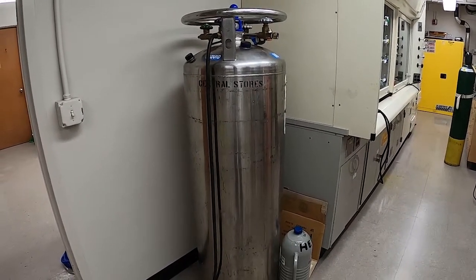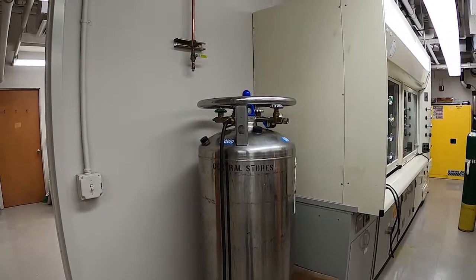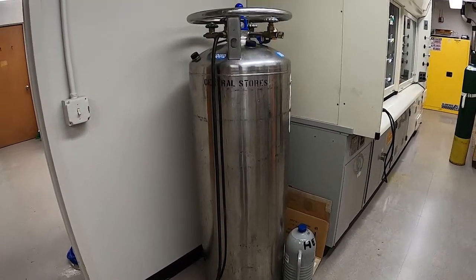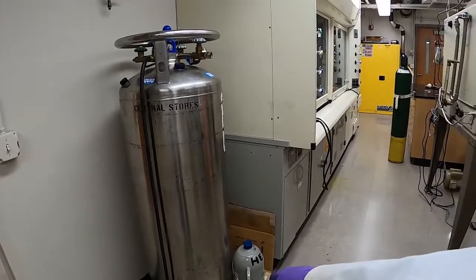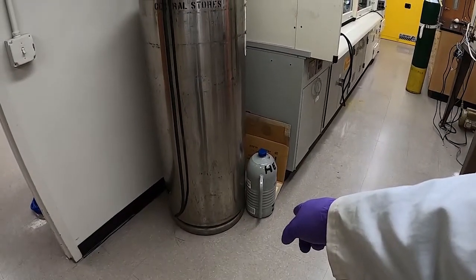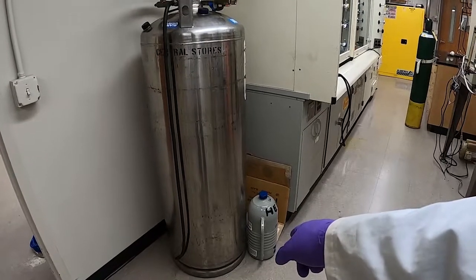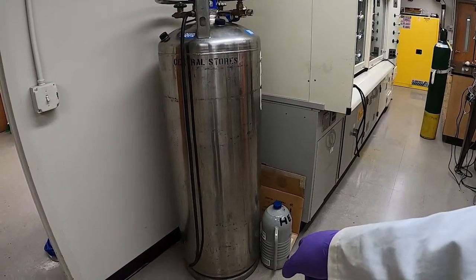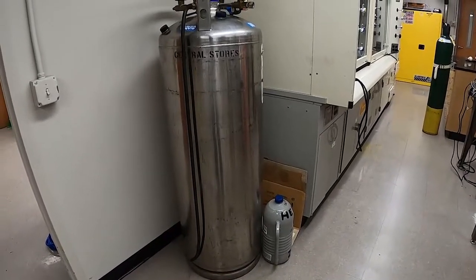That means we have to highlight how to get liquid nitrogen. This is our nitrogen tank — it's called a Dewar or a lock set. We're going to use that small handheld Dewar on the floor, get some liquid nitrogen into that, and have it on hand to make our cold bath with.